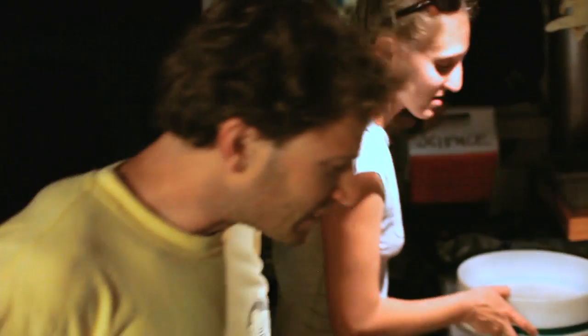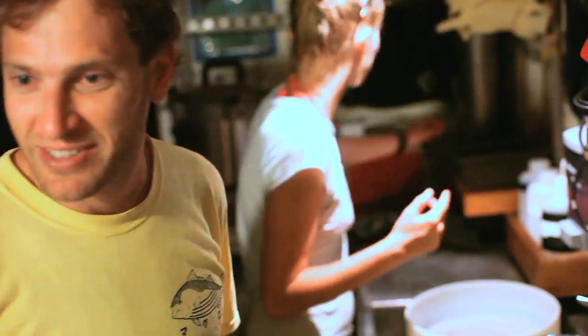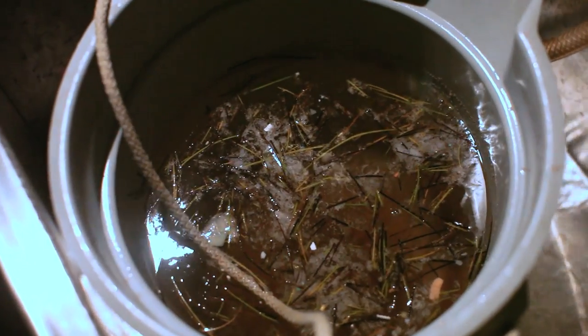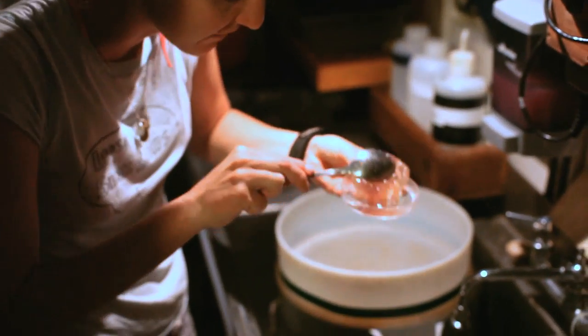Where are we here? We're about to pour this in here. Lisa's just putting our — so the jelly's still in there? Jelly's still in there. I'm going to take it out because I think it's going to eat some of our stuff. Alright, biomass — dump it.